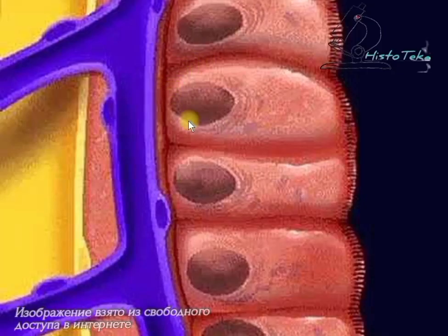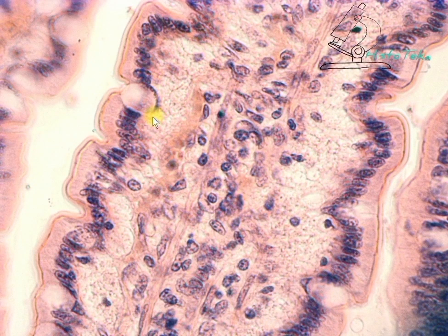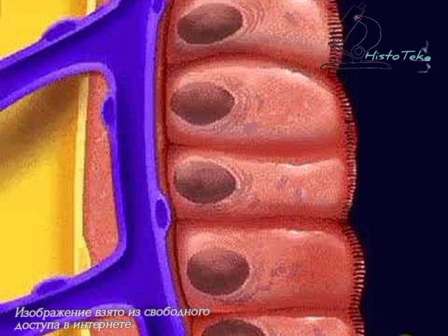Simple means that each epithelial cell is adjacent to the basement membrane. The basement membrane is located between the epithelial and the underlying connective tissue. It is not visible on the preparation, but it is visible that the cell's nuclei lie in one row. Columnar indicates the shape of the cell, meaning that the height of the epithelial cell is greater than the width.